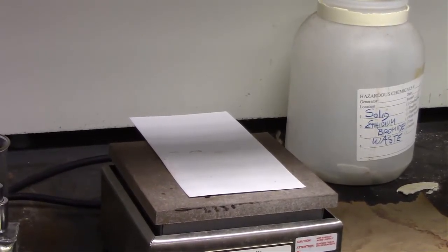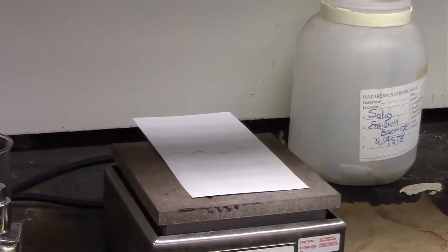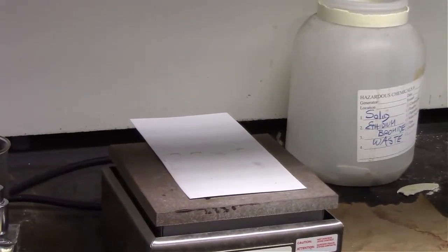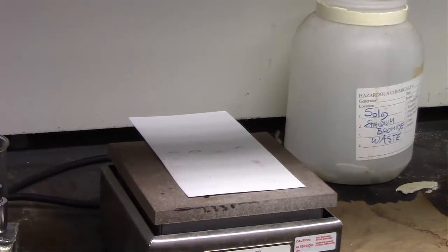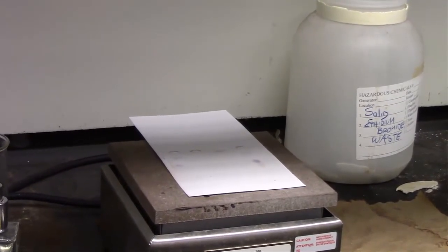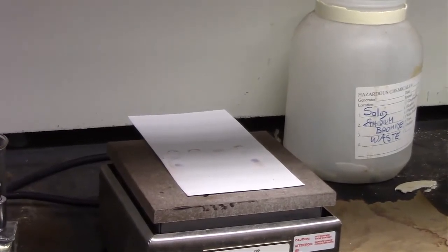Now on the left and the right, specifically in the top part, you can start to see the ladder form. It looks like it's also pretty hot down toward the bottom right-hand corner of the plate, which is where that 5 amino acid molecular weight ladder is. So essentially our reference ladder.